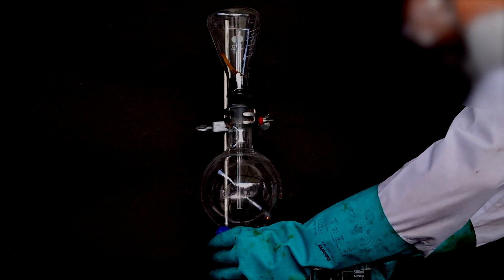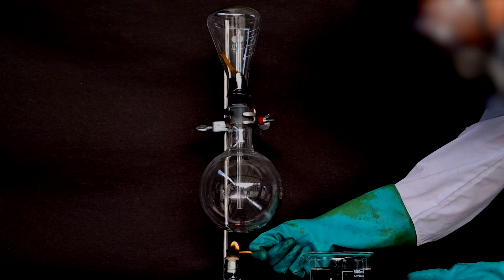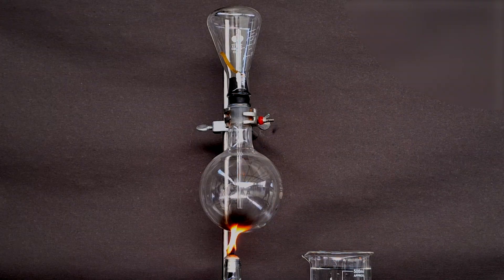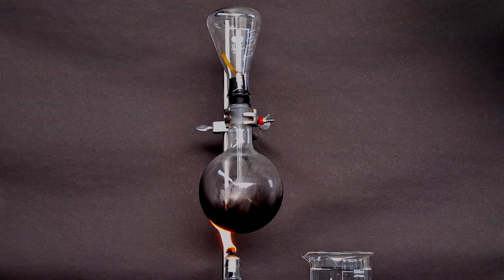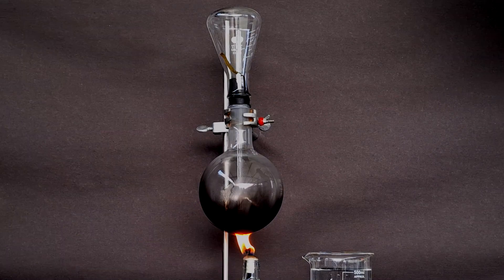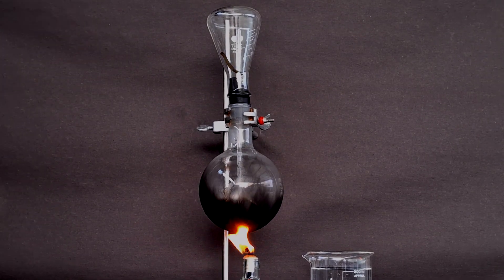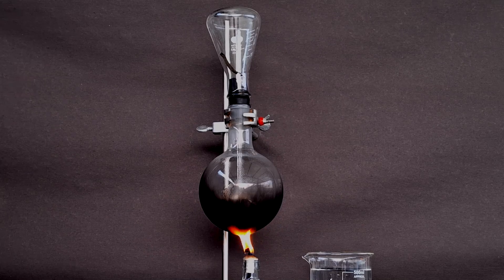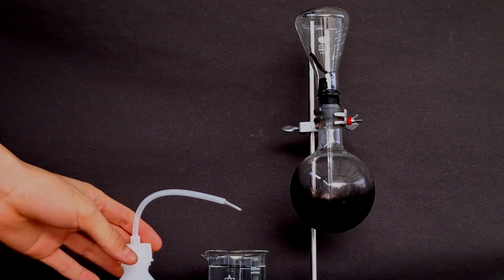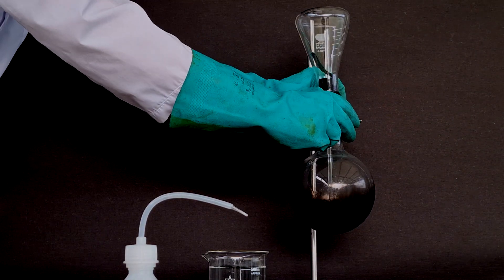Then carefully lighting the kerosene-filled lamp underneath the round bottom to start the production of ammonia gas. It should be noted that ammonium hydroxide boils at roughly 38 Celsius. Therefore, heating it for a short time should suffice.